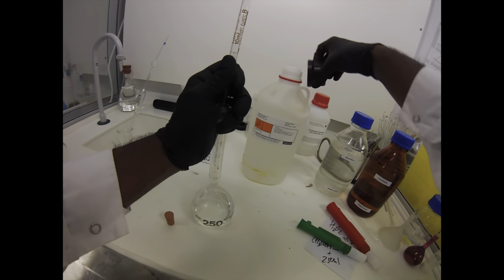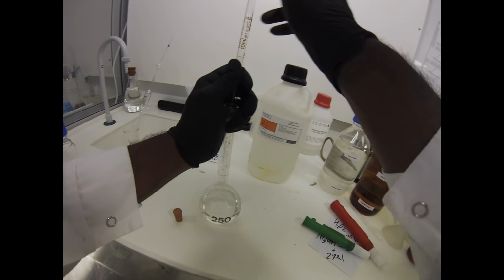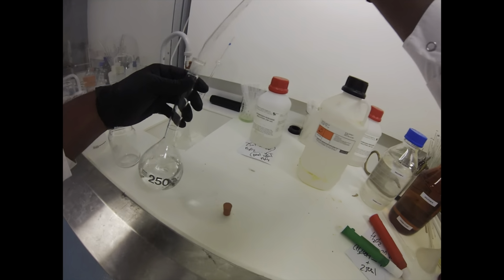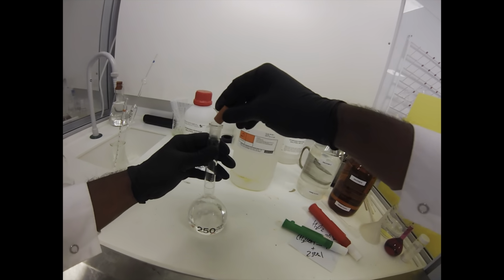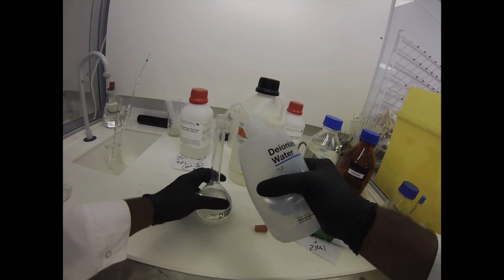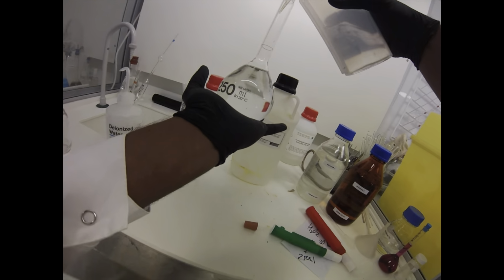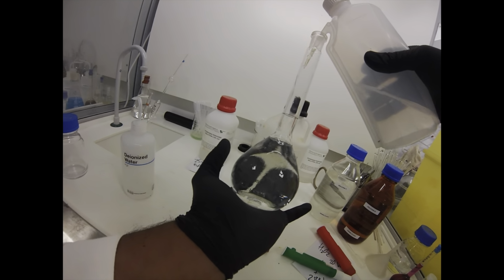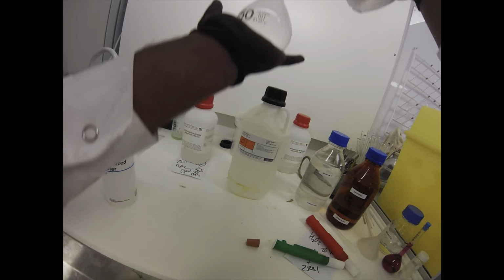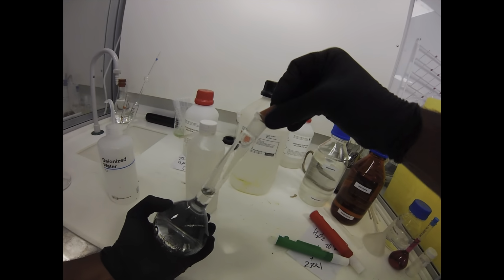And that is pretty much it. We'll pop the lid on that acetic acid, and then we're just going to top up the volumetric flask with water to the line. Give everything a good mix so we're all homogeneous and evenly distributed. Final top up to the line at eye level. We'll do our 10 inverts, and then we'll look at the chemistry behind it.